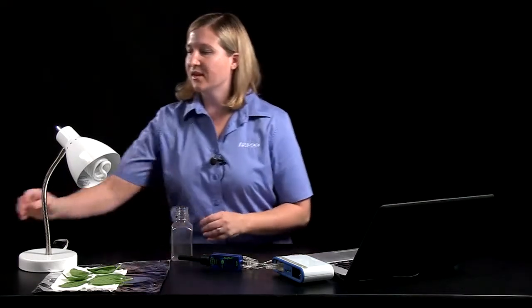The lab is designed to help students review the overall process of photosynthesis and help them relate what they've learned about plant cell structure and the processes of photosynthesis and respiration to the global carbon cycle. It's a lab that is easy for students to set up and collect data in a relatively short period of time, and is a good one giving very consistent results.